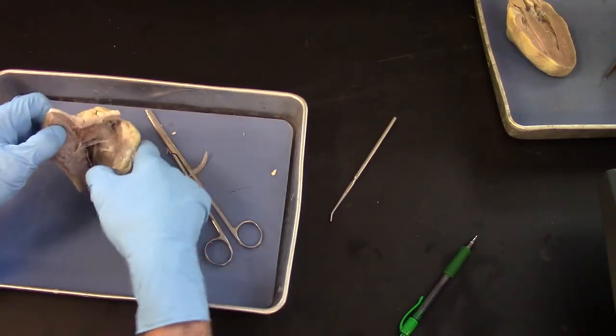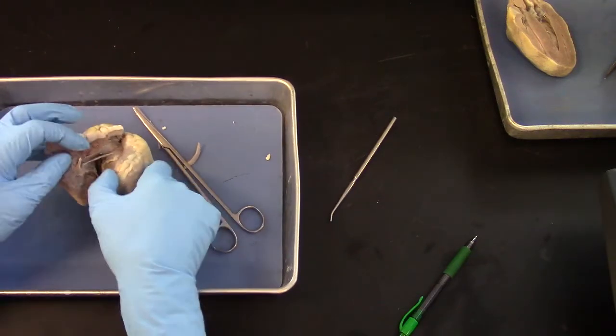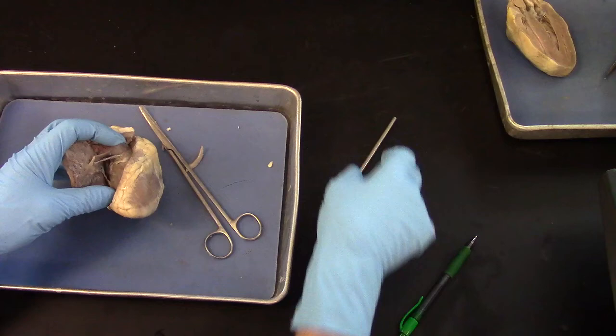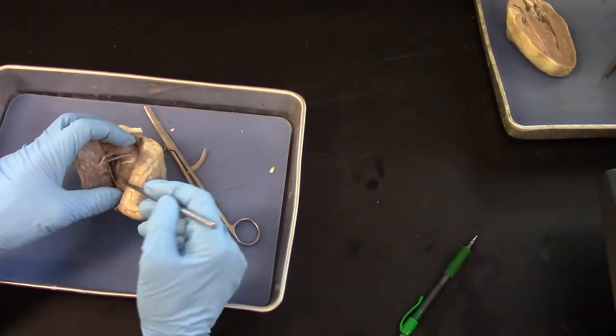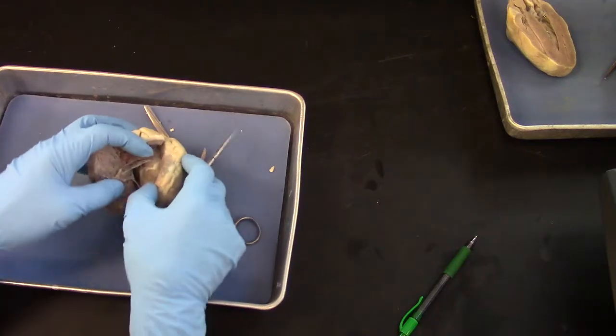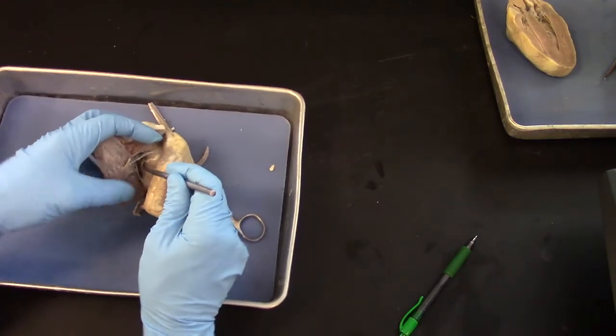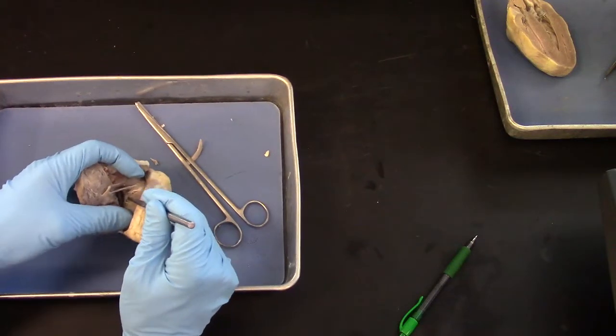So this is right ventricle, and looking inside there is the tricuspid valve, and these are the chordae tendineae, and the flaps of the valve are very delicate, and so these come up. I hope you can see this in the film.